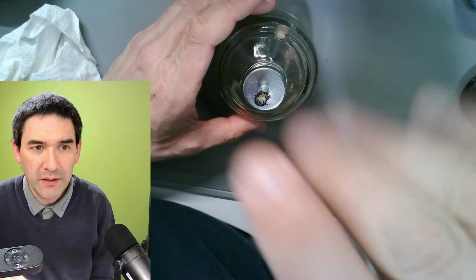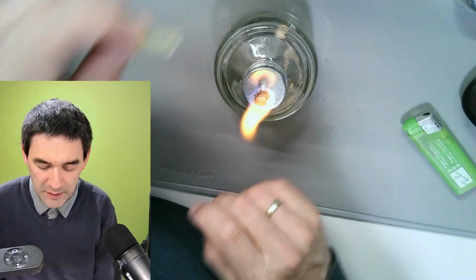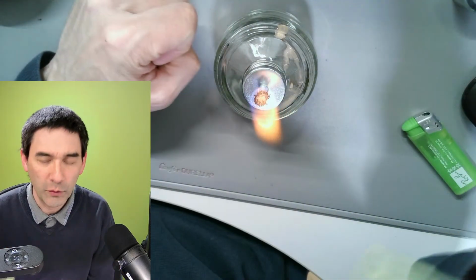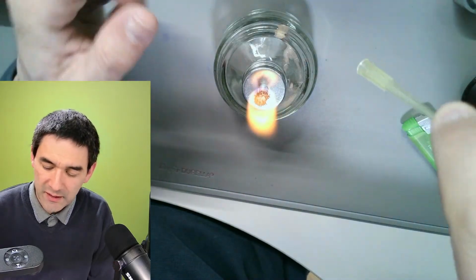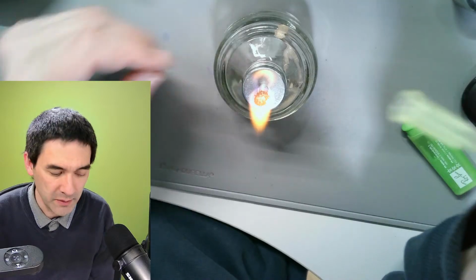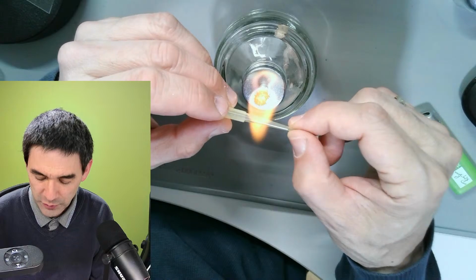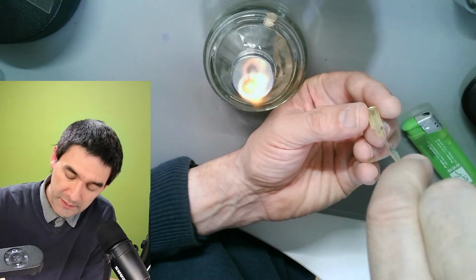So it's not directly beneath the camera now. Okay, so that's an alcohol burner. And then what you do is you try to melt the plastic over the flame, and then immediately you turn it vertically. Otherwise, I've found difficulties. But this might not work the first time. Okay, so I'm going to try this a few times maybe. You rotate, rotate, rotate, rotate, rotate, rotate, and vertically, you hold it vertically, and then you carefully pull it.